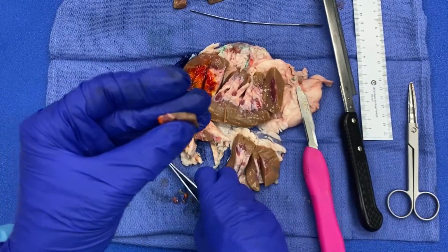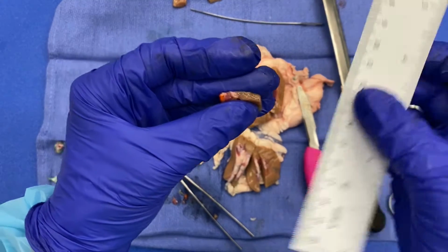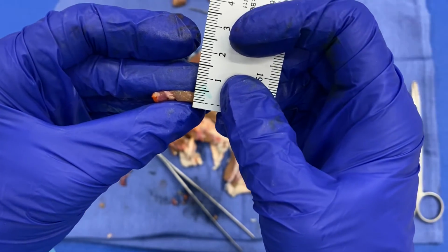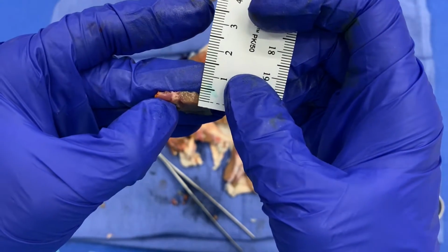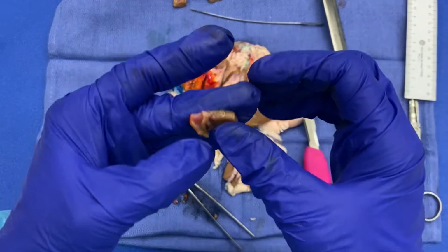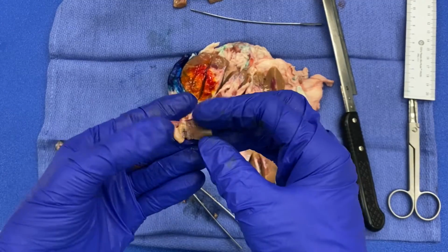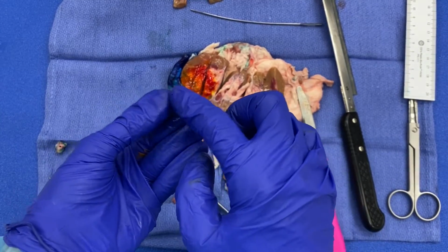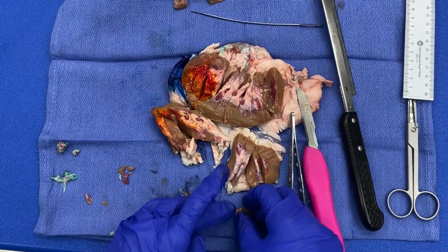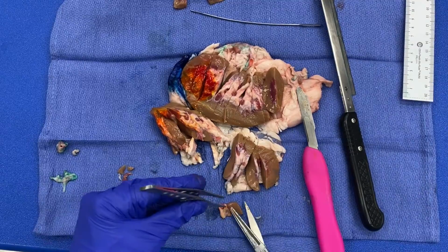Okay, if you're unsure when you're looking at your specimen, I know I've talked about this in our clinical correlations laboratory quite a bit, but you can just take your ruler, okay? So this is about 0.3, 0.4. It's bordering on a little thick. It looks okay on this end. So hopefully, you'll start to memorize what that thickness looks like in your mind so that you don't need to use the ruler anymore.